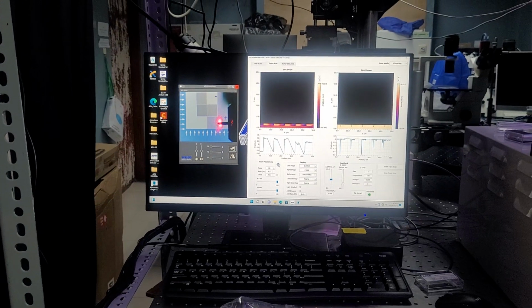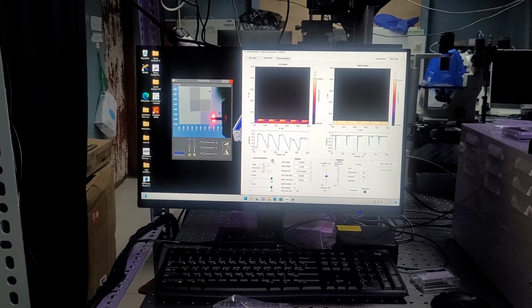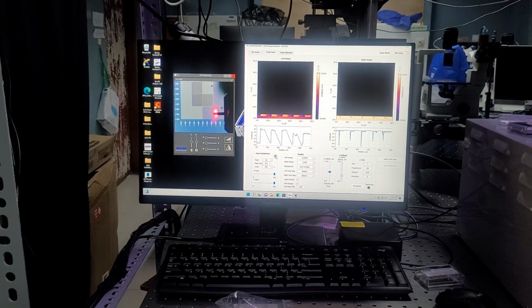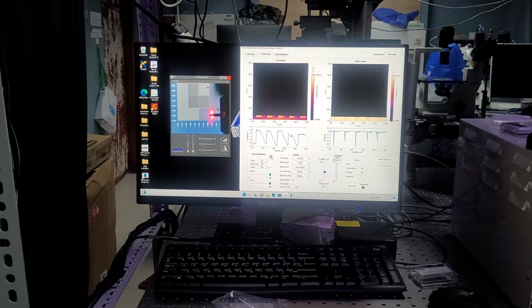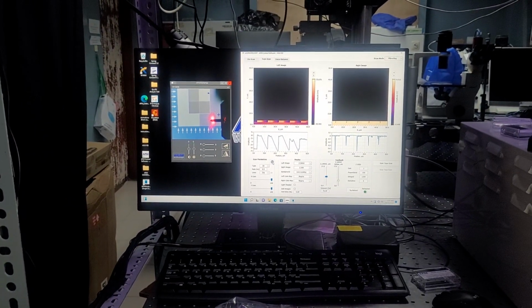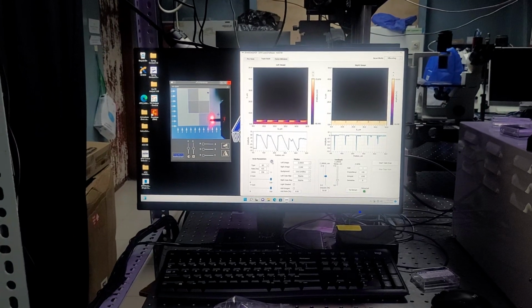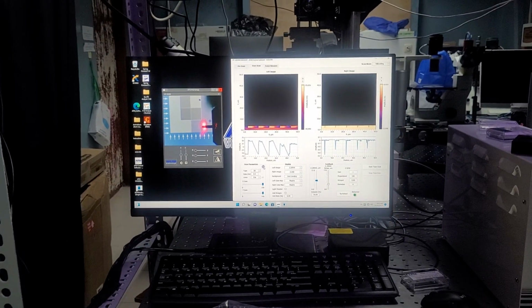So adjusting those values is essentially going to adjust the amount of voltage that's being supplied to the piezos and can cause them to start to retract. That's why you don't want to do it while you're on the surface, because it can cause those piezos to move and shift into place, and you'll just ram your tip against the sample surface.